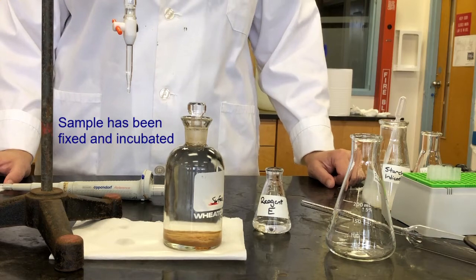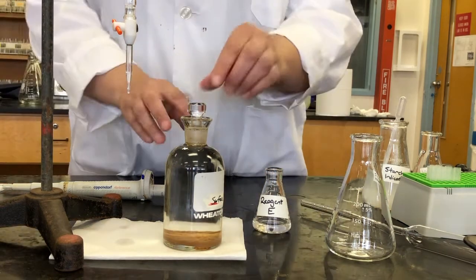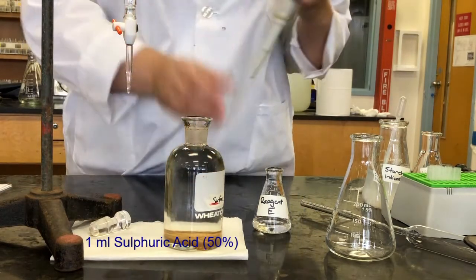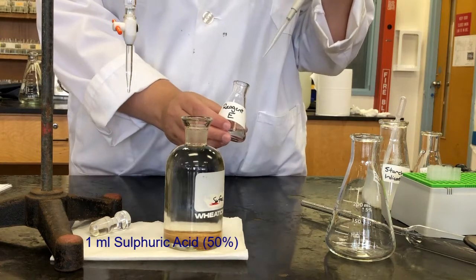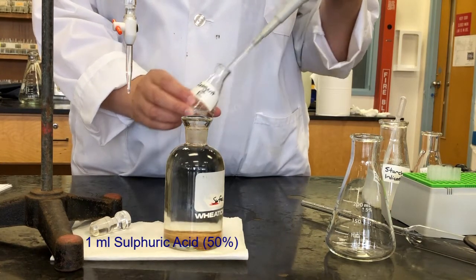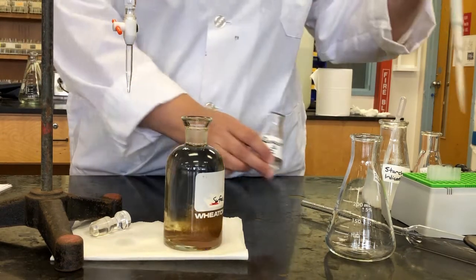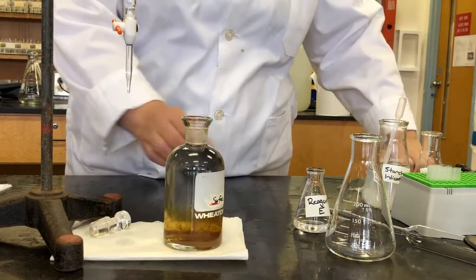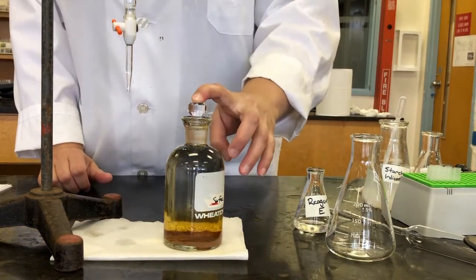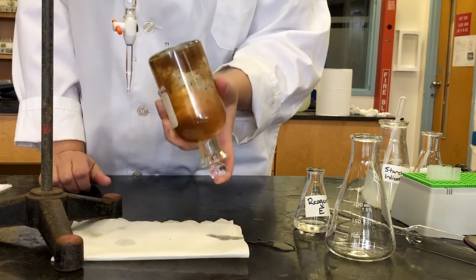So now we're going to do the next step in our sample analysis, which is adding 1 milliliter of sulfuric acid, so we're acidifying the sample. So that's reagent E, our sulfuric acid, 50% sulfuric acid. So we're going to add 1 milliliter. Stopper again. Okay, and now we are going to shake that.